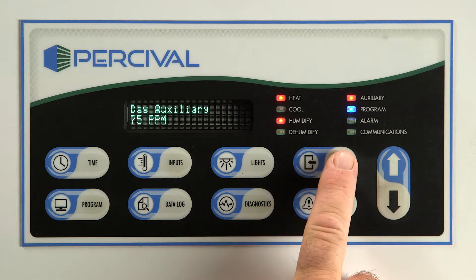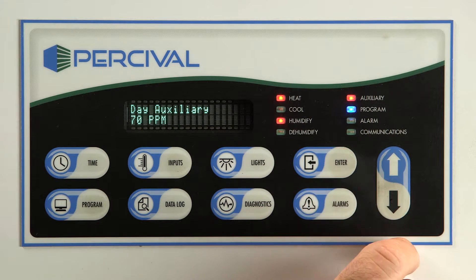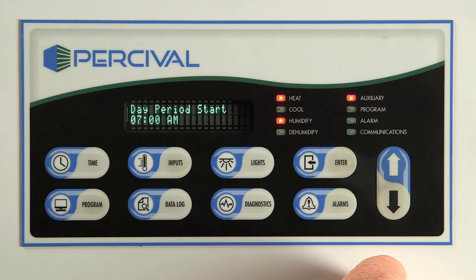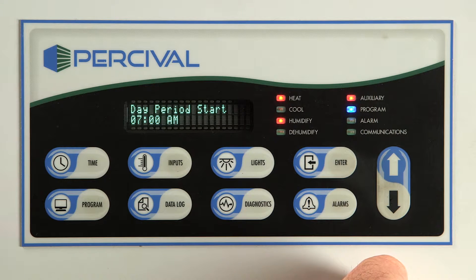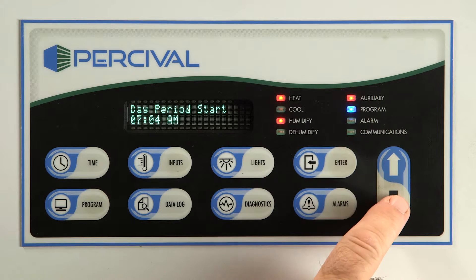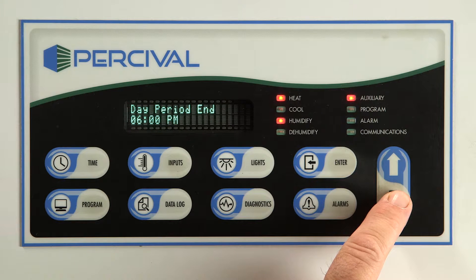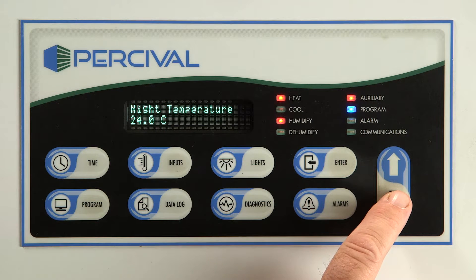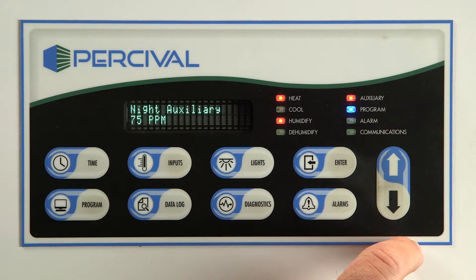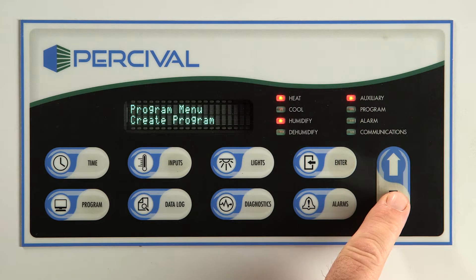Press enter to adjust day auxiliary if equipped. This would usually be CO2. Use the arrow keys to set the level. Arrow down to next step. Press enter and use the arrow keys to select the day period start time. Arrow down to next step. Press enter and use the arrow keys to select the day period end time. Arrow down to next step. The next few settings are your night temperature, relative humidity, and auxiliary settings. Adjust them the same way as you did the day settings.